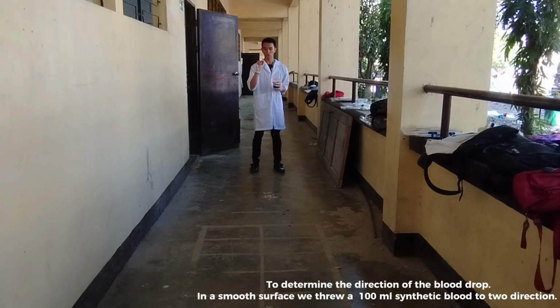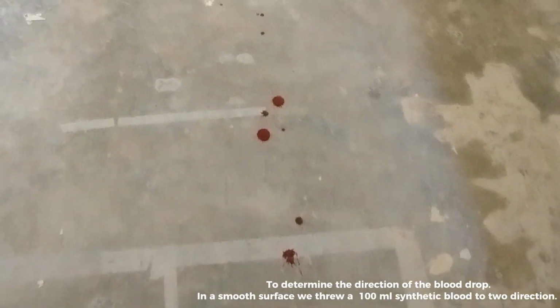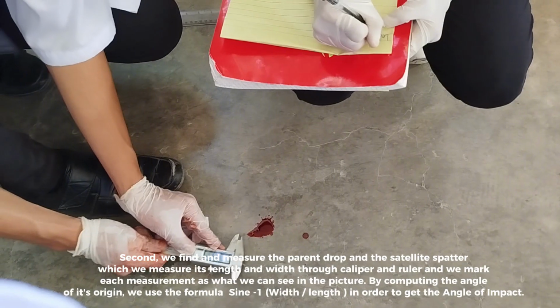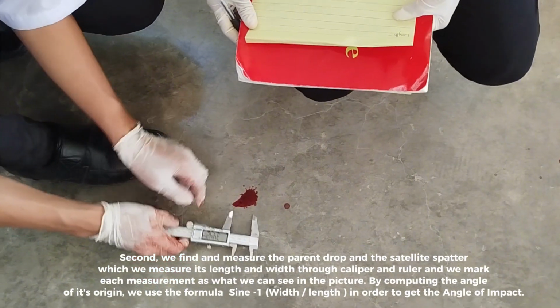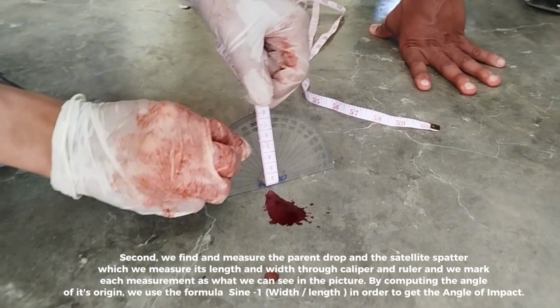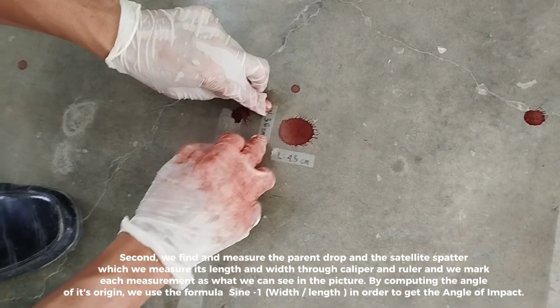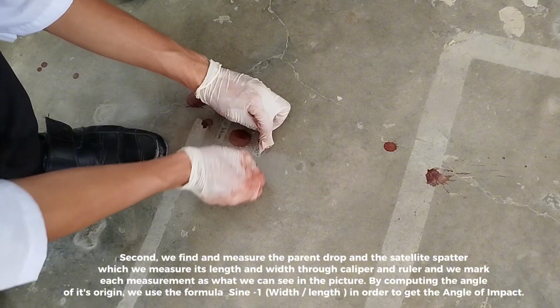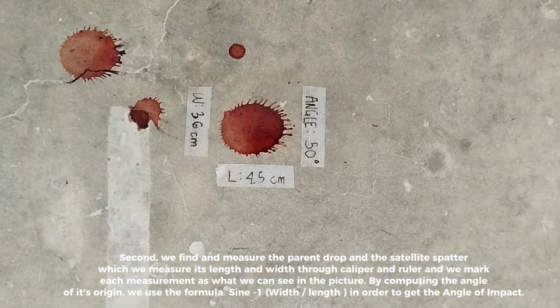To determine the direction of the blood drop on a smooth surface, we threw 100 milliliters of synthetic blood in two directions. Second, we found and measured the parent drop and the satellite spatter, measuring their length and width with a caliper and ruler, and we marked each measurement as we can see in the picture. To compute the angle of origin, we use the formula sin^-1 (width/length) in order to get the angle of impact.